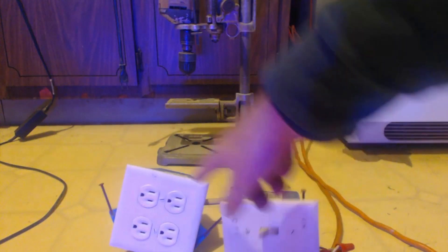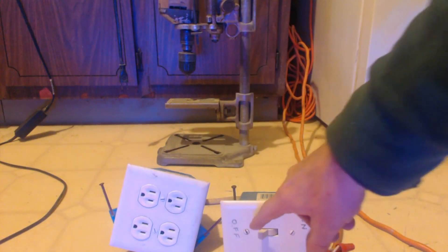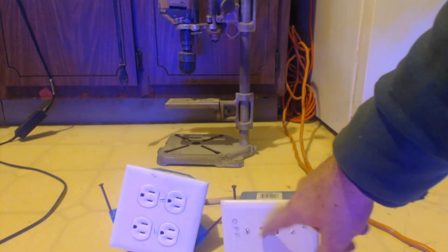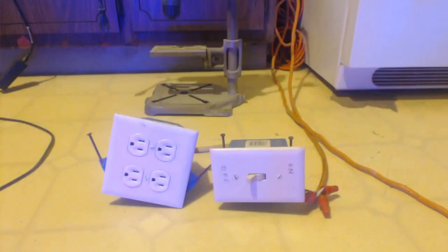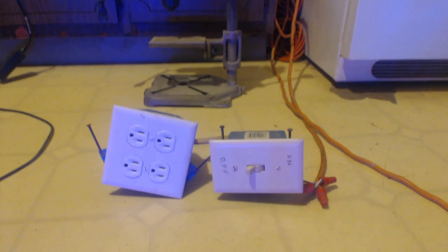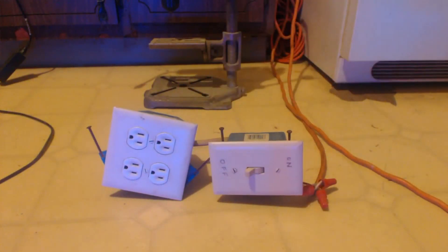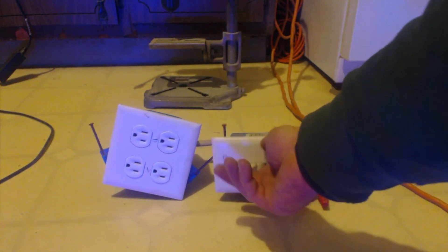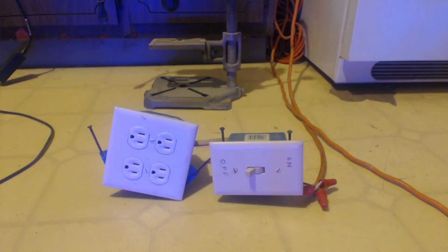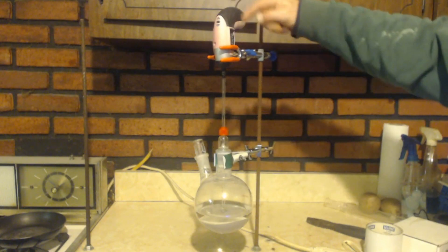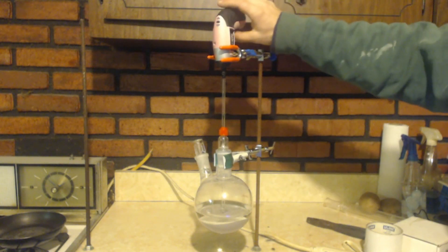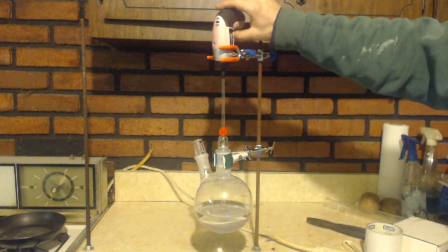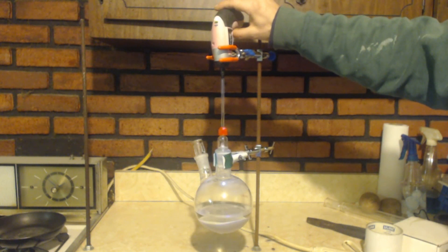Now I could, I should have made this into a dimmer switch, I would have been even better, and then I can plug the drill into here and I can use my dimmer switch so that it's not going so fast if it's unreal or whatever. Just put a twist tie thing around the trigger.